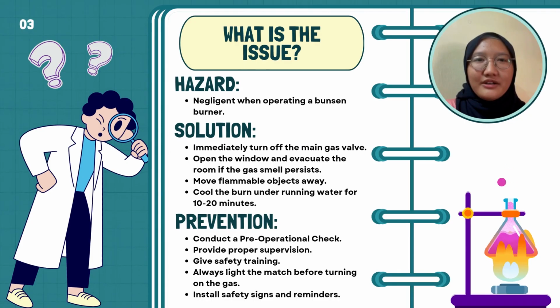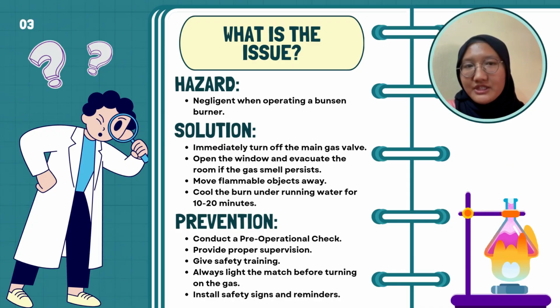I'm going to talk about the issue highlighted in the video. The hazard that happened in the video is negligence when operating a Bunsen burner. It can cause a fire or lead to inhalation of harmful gas, because Bunsen burners typically use methane. The gas is flammable and hazardous if inhaled because it displaces oxygen and increases the risk of fire or explosion.